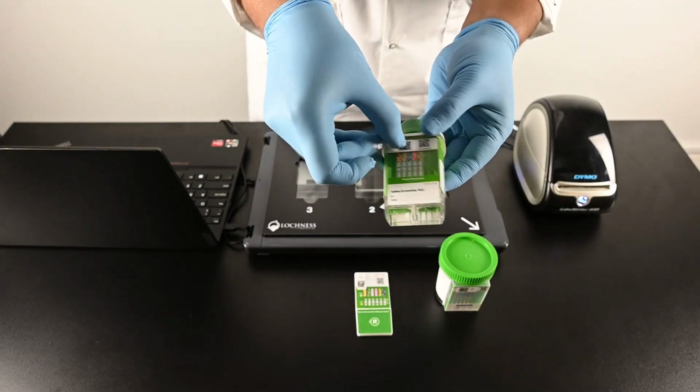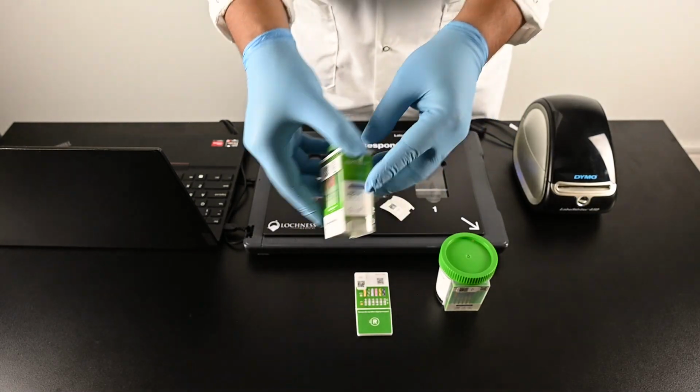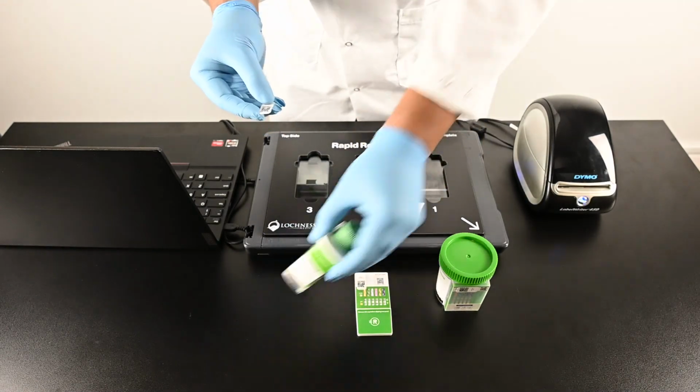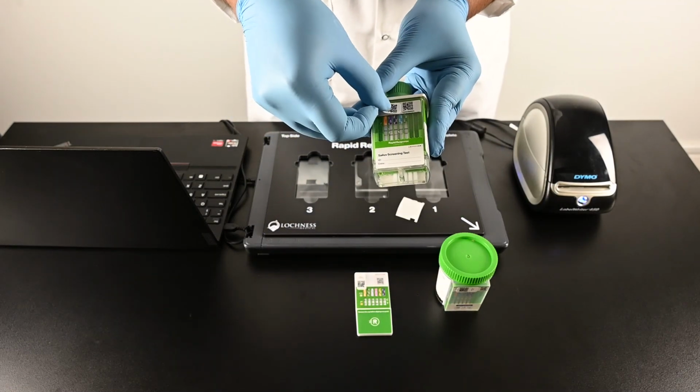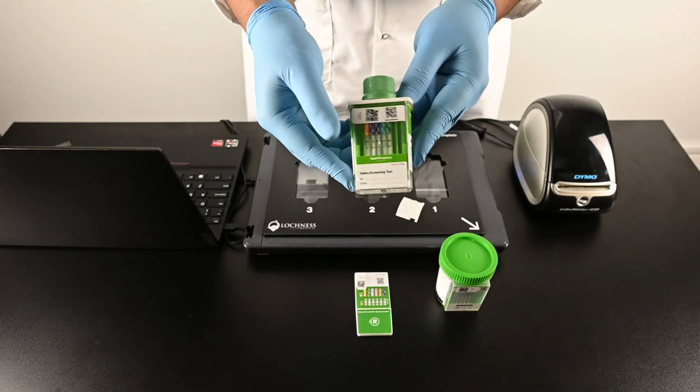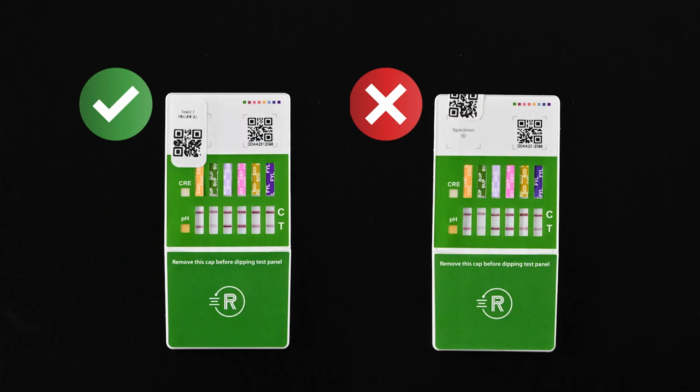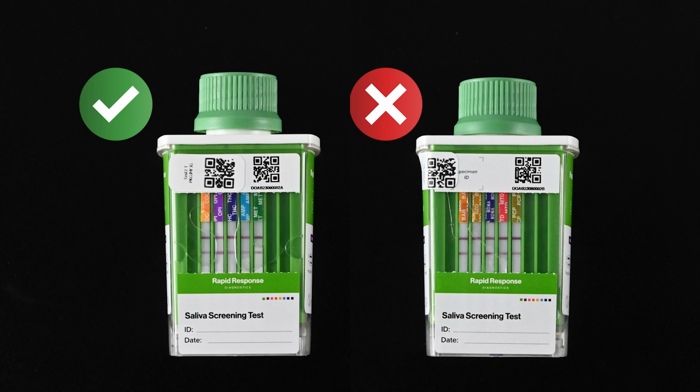2-sided test devices will require 2 QR codes. After the first sticker has been attached, flip the test device over and place a second QR code sticker on the reverse side. It is important to make sure the QR code is visible to ensure the code is scannable.